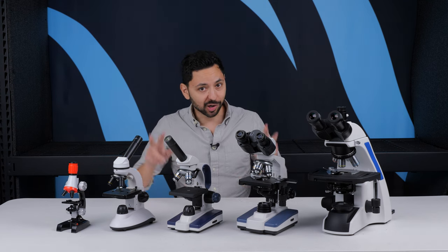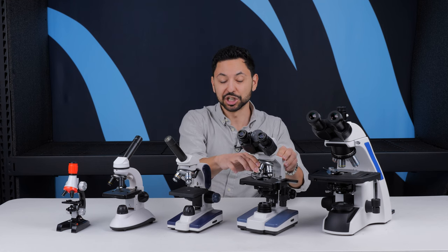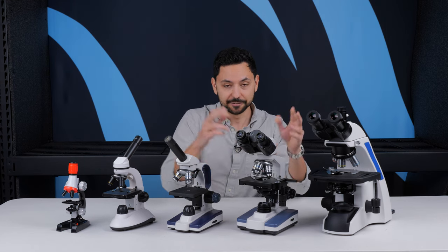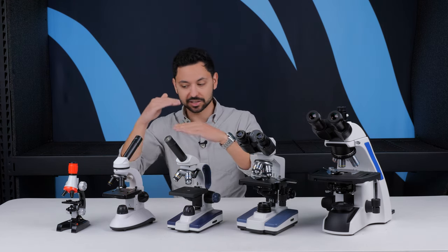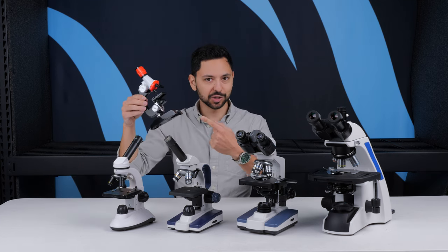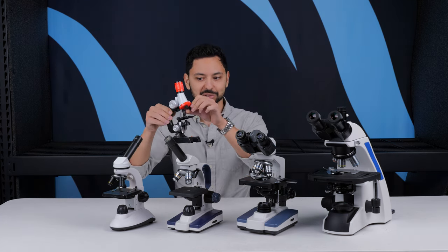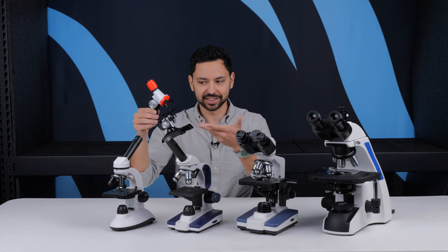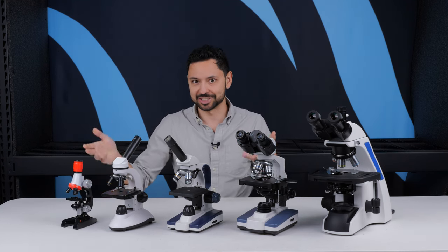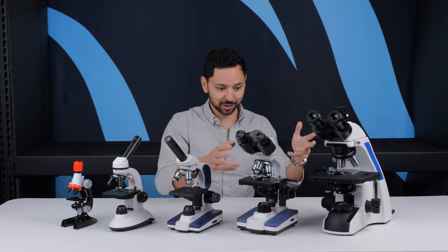Even though the compound part of a compound microscope only really refers to the objectives themselves having a fixed magnification and fixed working distance, technically this little kid's toy is a compound microscope — even though functionally it doesn't really perform the same sort of tasks that you can get on a real microscope.